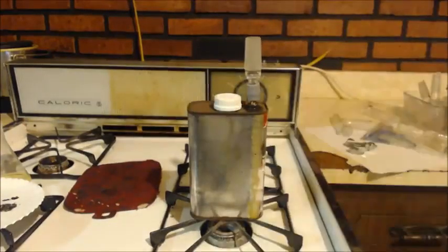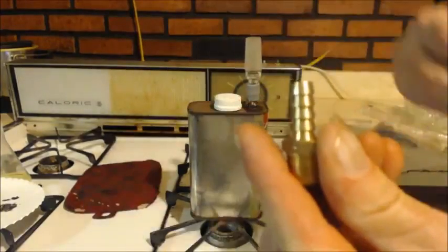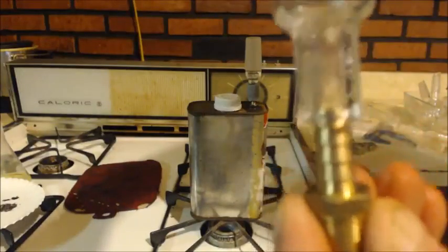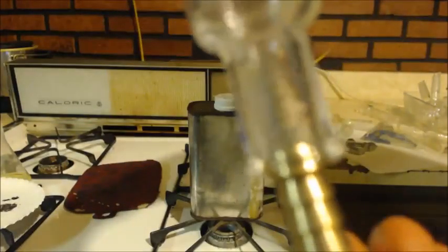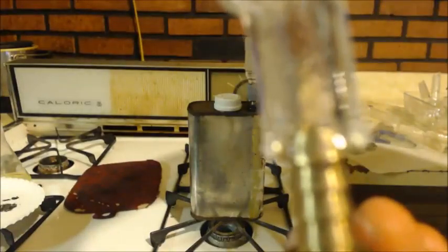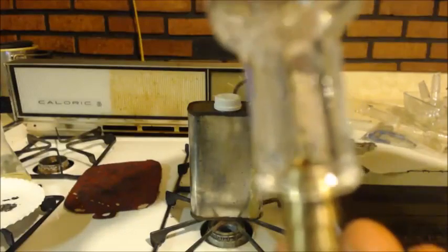I want you to look at this without the gasket. Here's the bottom, right? Here's the top. See how it actually goes inside that glass? It's a perfect fit, you know what I mean? So as long as it stays like that, none of your gas should touch the gasket, or very little.